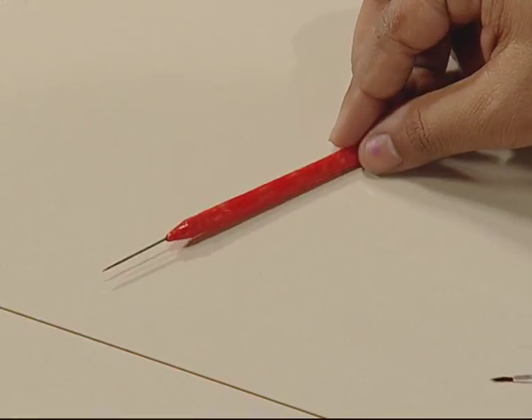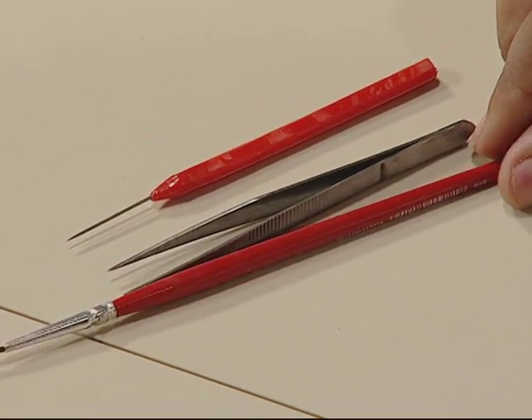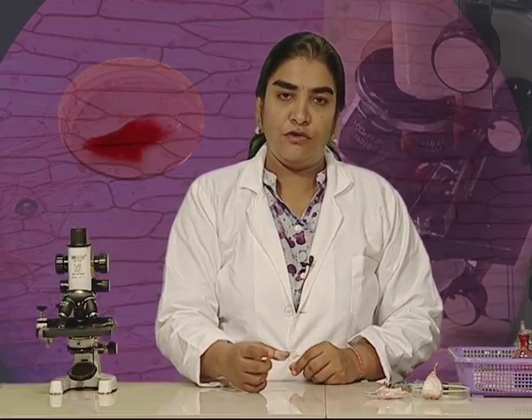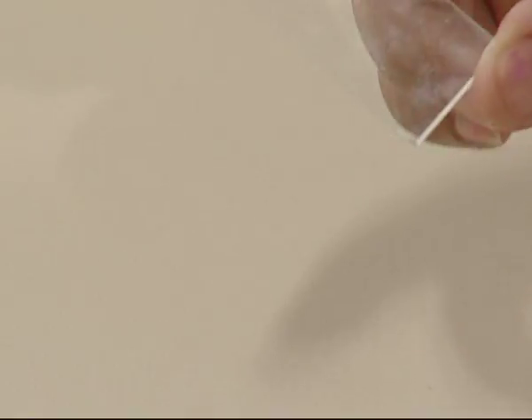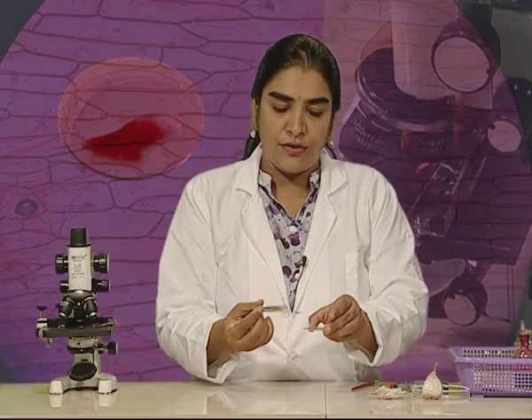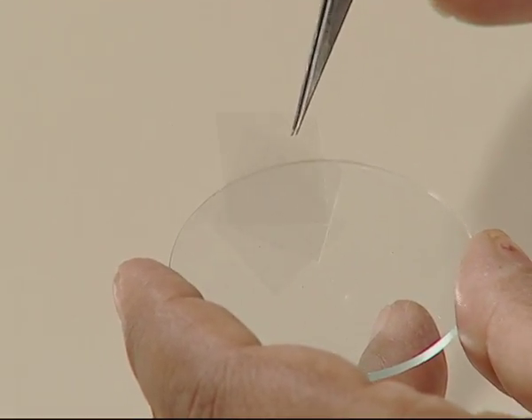We also require a dissecting needle, a forcep, and a brush. We need a slide for making the temporary mount — make sure you hold the slide by its edges so it does not get dirty, and use only a clean slide. We also require cover slips for covering the mount we will be preparing.